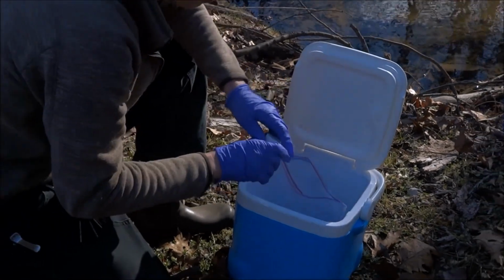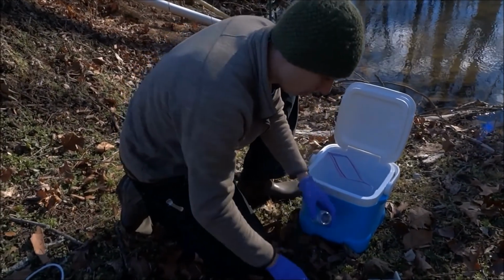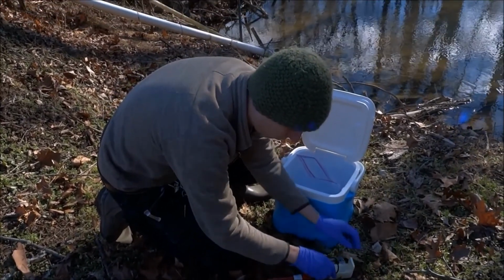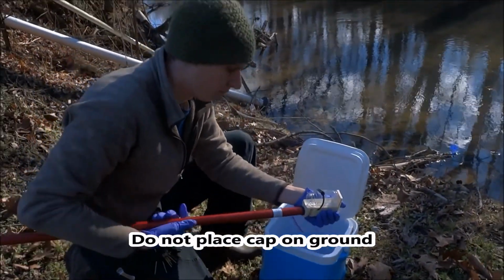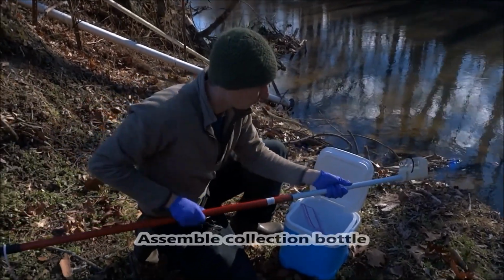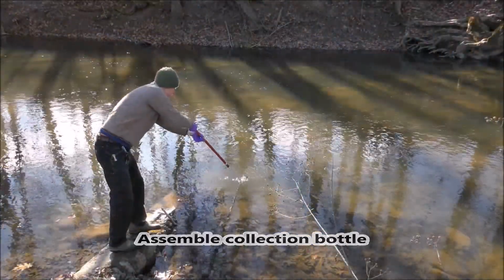If you are using a sampling dipper stick for hard-to-reach spots, take the collection bottle out of the sampling kit Ziploc bag, open the bottle, and to avoid touching the inside of the bottle or cap, carefully place the cap in a sanitary place, such as inside the Ziploc bag. Do not place the cap on the ground. Assemble the collection bottle on the end of the dipper stick, making sure it is secure.